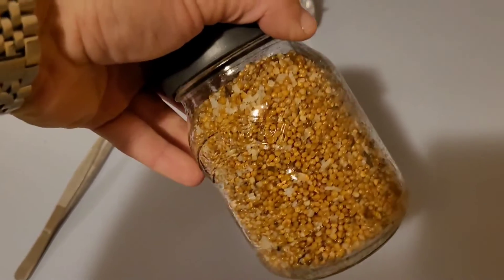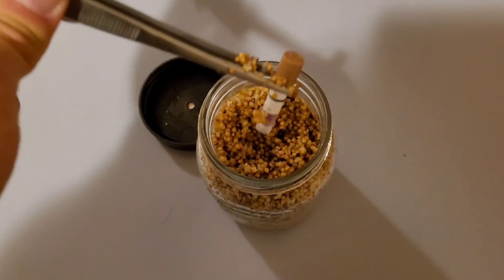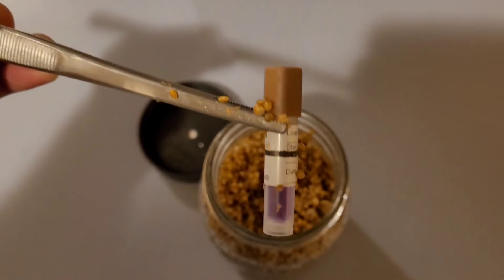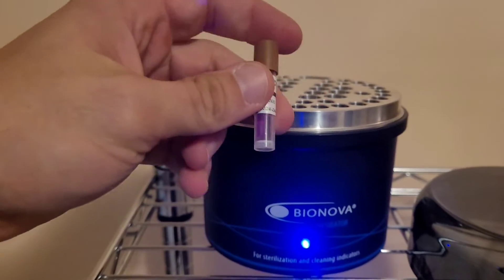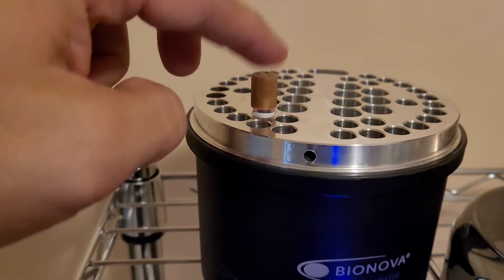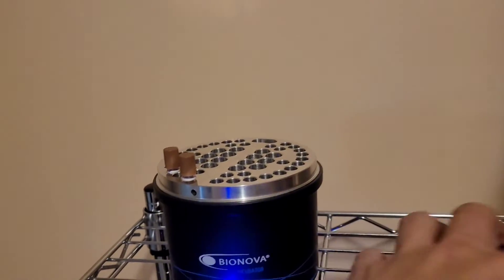The grain looks pretty good — I'd run that for sure. The chem strip has turned black. Biological indicator: snapped, shaken, placed into a slot, and same with the control. 24 hours at 60 degrees Celsius. See you then.